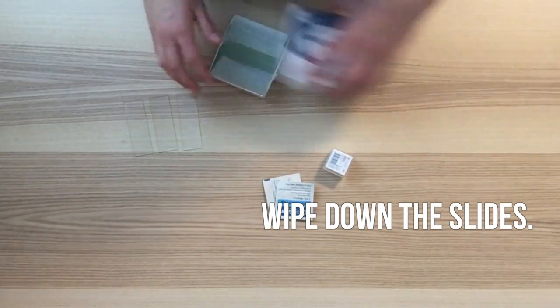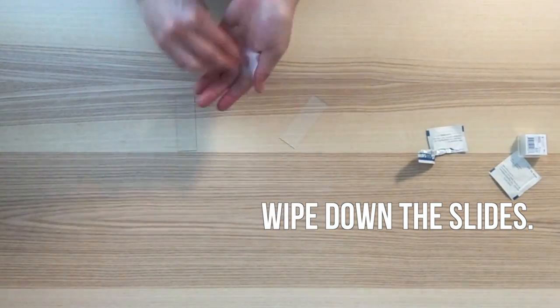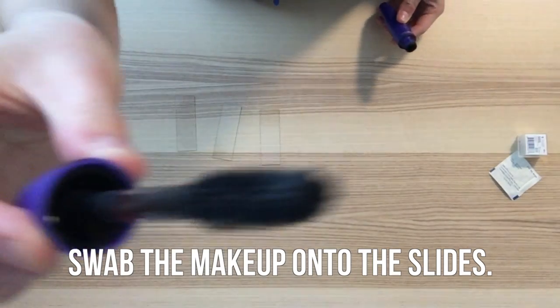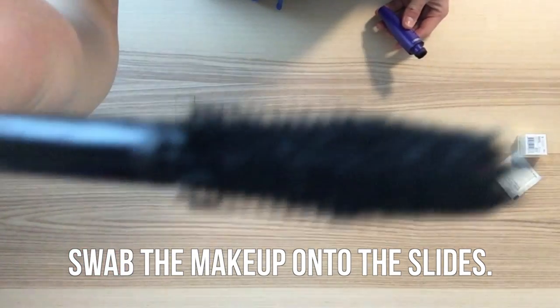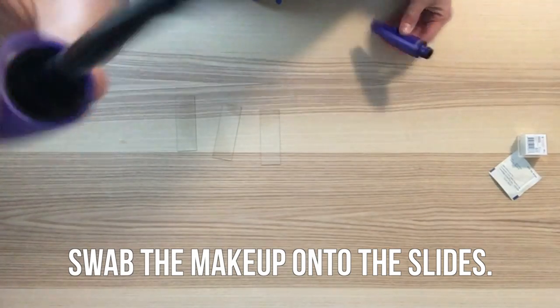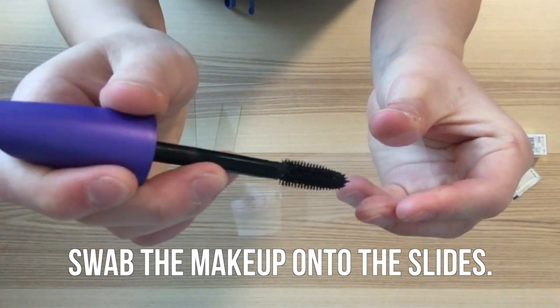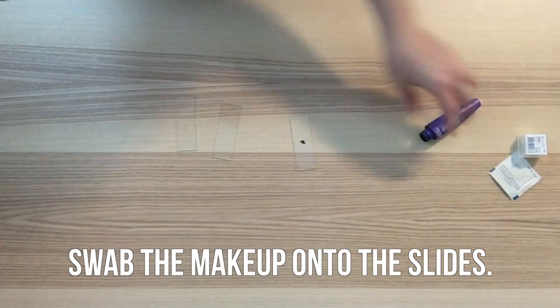Use an alcohol wipe to remove dust from the slides. Now, you're going to want to swab the makeup onto the slides. Carefully place the sample of the makeup onto the middle of the slide. I used the very tip of my mascara brush to get this sample.